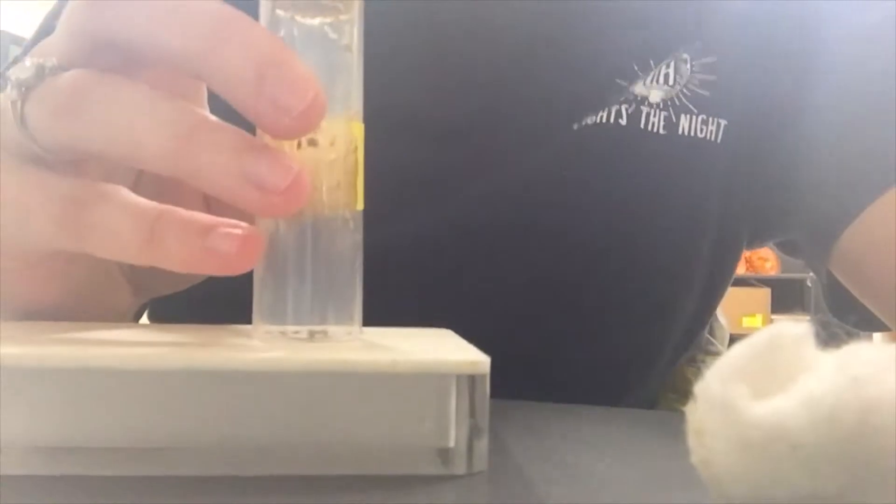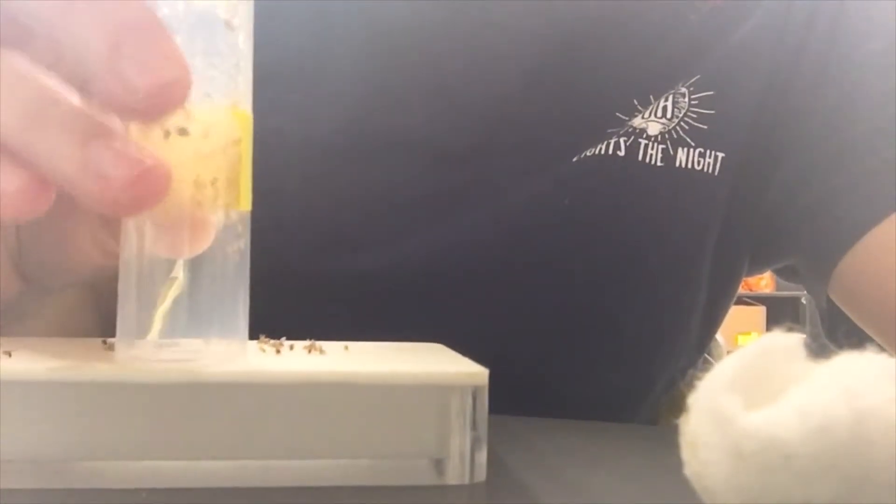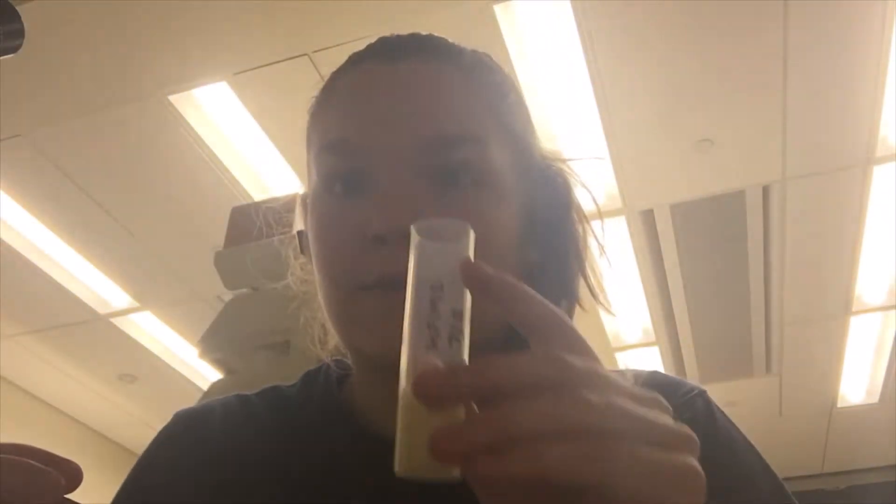You turn your fly pad on and tap to get all the flies to the bottom of the vial. They're a little uncooperative today. Tap them onto the fly pad like so. Then when all of them are on the fly pad, take your new vial — some of them are freaking out a little bit but they're all asleep. My camera skills aren't the best with my phone, so I apologize. Normally you just use a little paintbrush, swipe them in there, and they're asleep so they won't wake up for a second or two — that gives you enough time to swipe them into their new home.